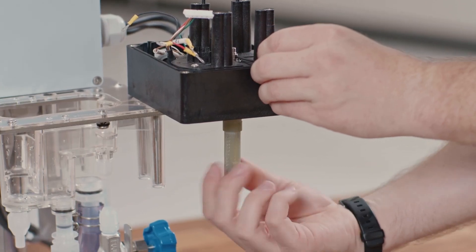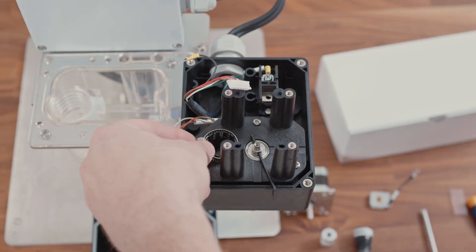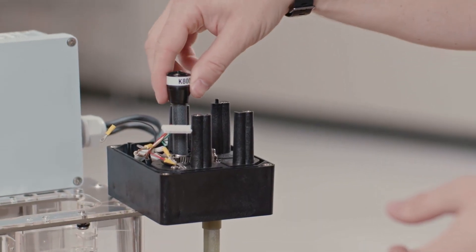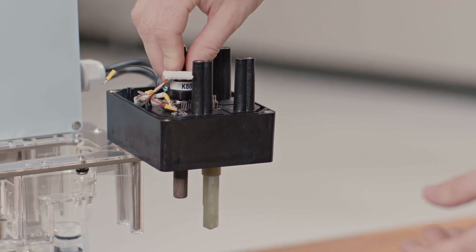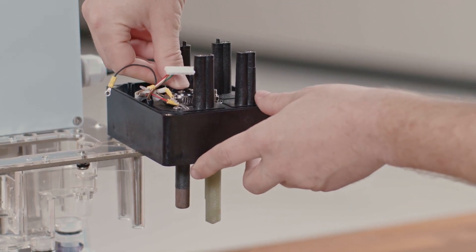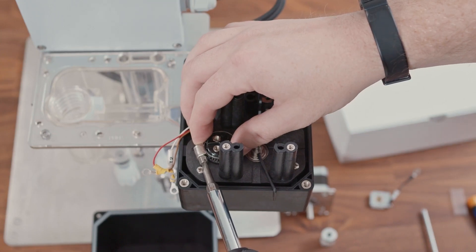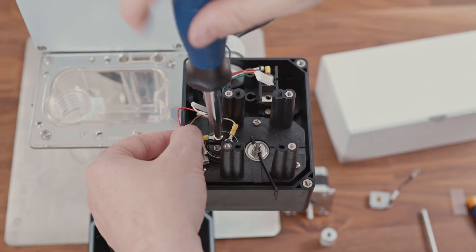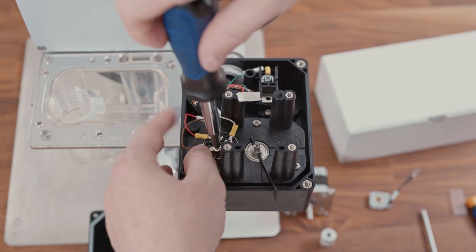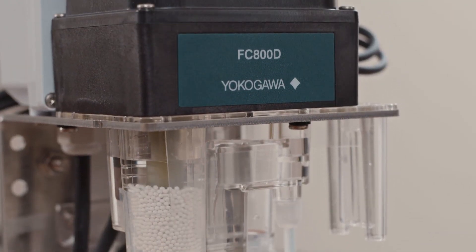You want to now replace the measurement electrode and the collar that you removed. We can now replace the reference electrode — it will slide back into the spot that you took it from. It will take a little bit of force because that gasket is sealing it, but once it is pressed all the way down and doesn't move anymore, tighten it with a flathead screwdriver. With the collar placed, reattach the wires making sure that the correct wires go into the correct terminal. Now that you have the reference electrode reinstalled, you can start building the drive shaft assembly back together, calibrate your analyzer, and put it back into operation.